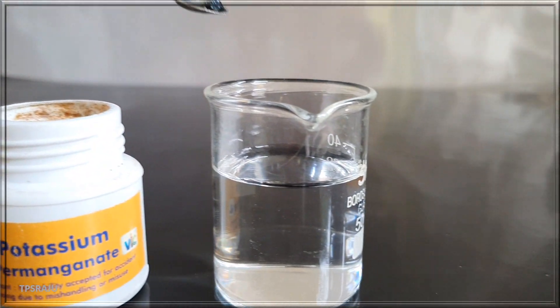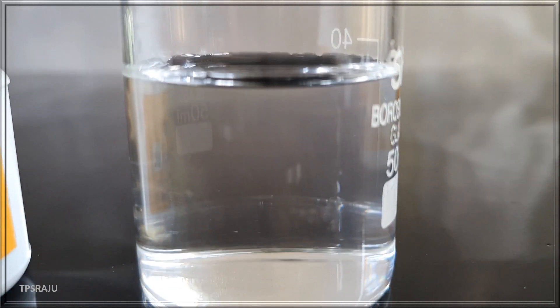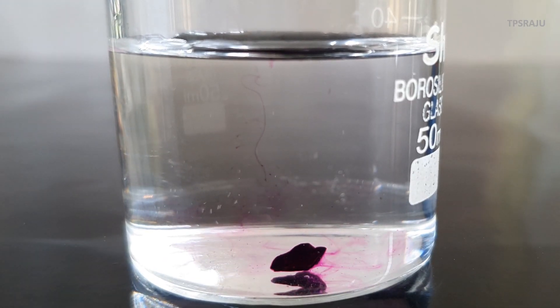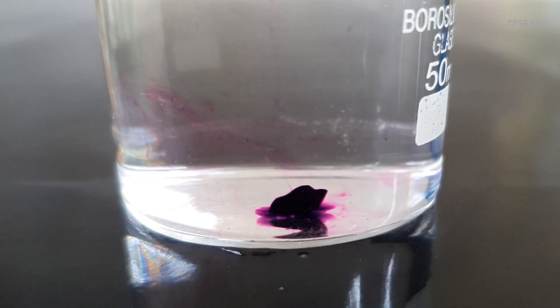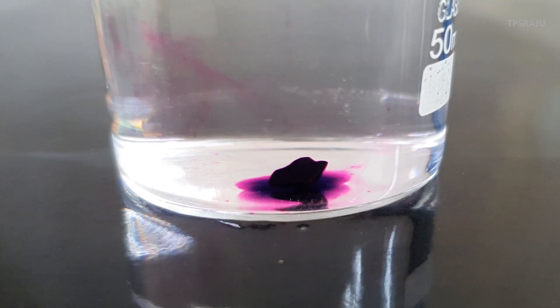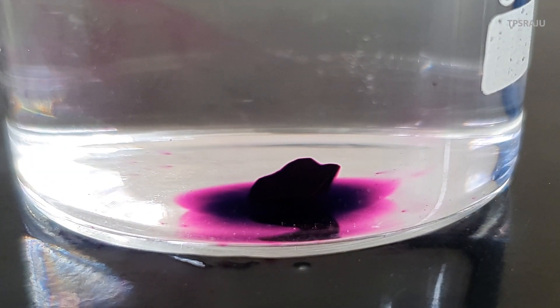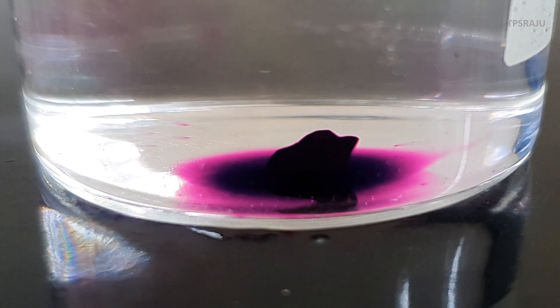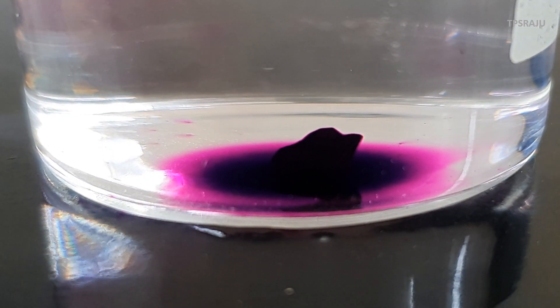For this activity, we have to take a crystal of potassium permanganate and drop it in a beaker containing water and observe carefully. What is happening here? Potassium permanganate dissolves slowly and spreads in the water. Due to high concentration around the crystal, it appears dark in color. From this high concentration point, potassium permanganate molecules move all around the crystal.